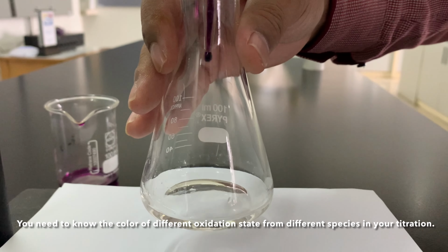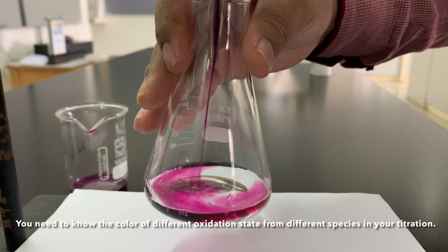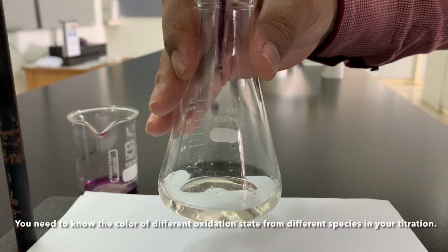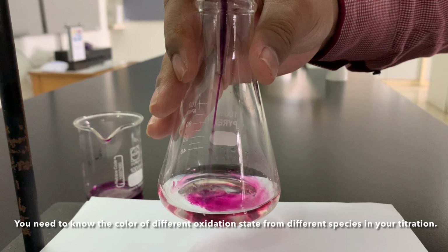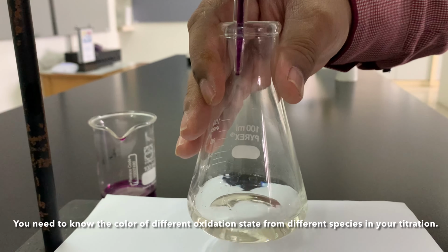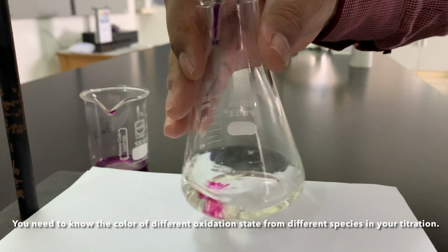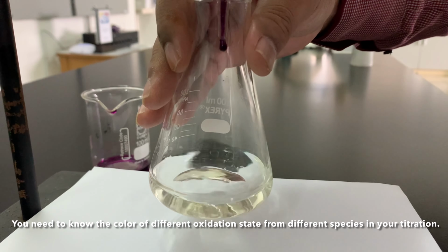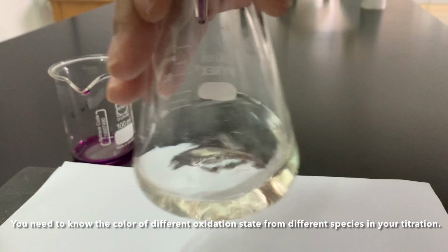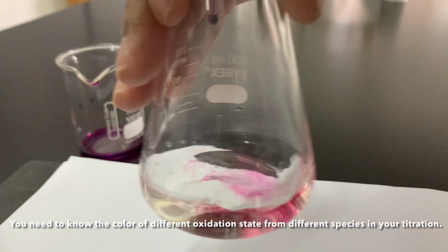Unlike acid and base titrations, where we have to see pH changes using indicators, many redox titrations do not need additional indicators. The changing of oxidation state of the species in the reactions usually shows different colors by itself. Hence, good research needs to be done first to find out what color all oxidation states in the reactions will show.